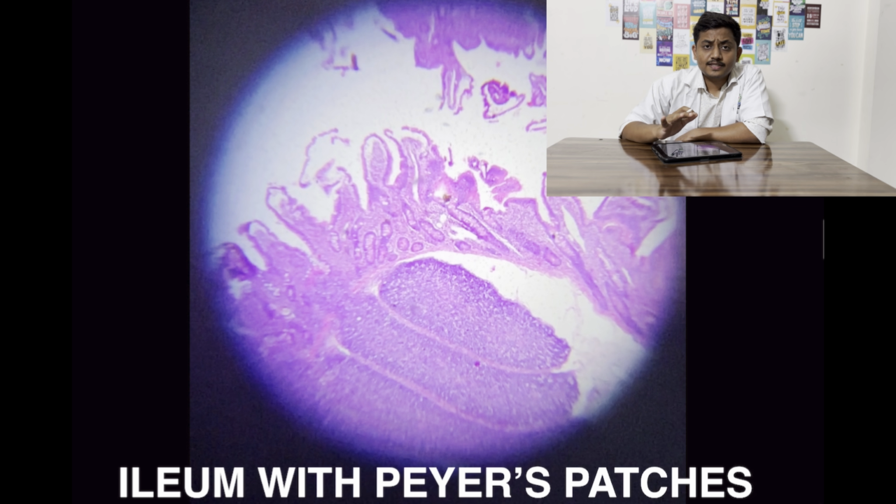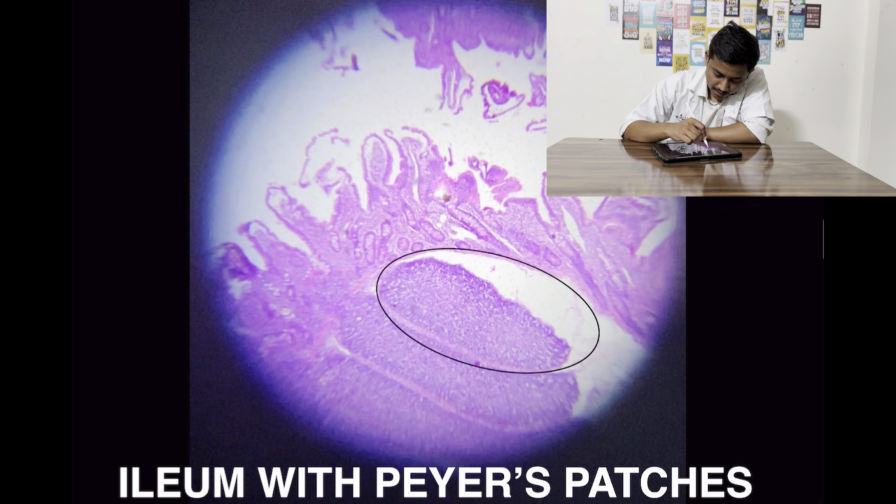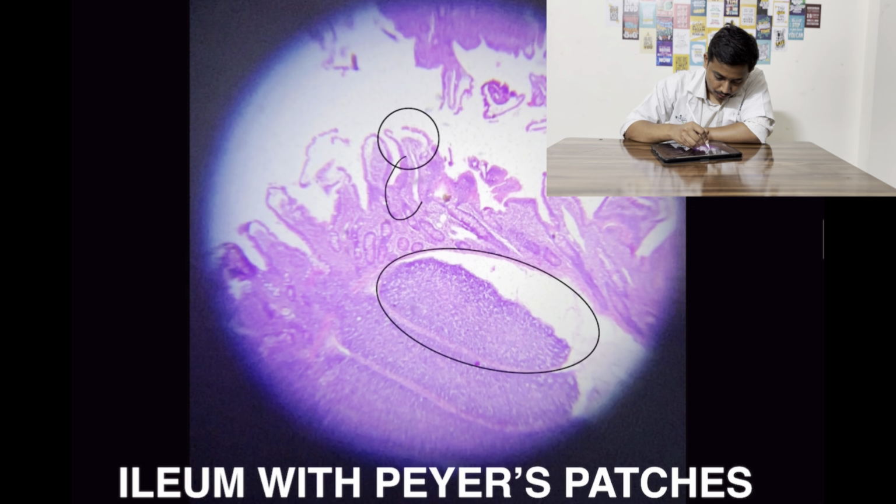Moving on to the fifth slide for today, that is ileum with Peyer's patches. So what are Peyer's patches? These are the Peyer's patches that you can note in case of this slide. So Peyer's patches are the lymphoid aggregates which are present in the submucosal layer of the ileum. The lining of the ileum is again by the simple columnar epithelium with an increased number of goblet cells which you can note over here.